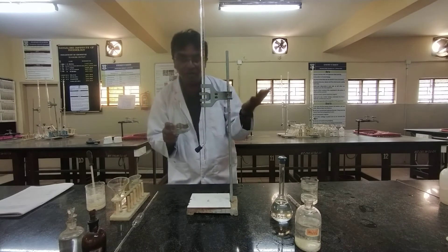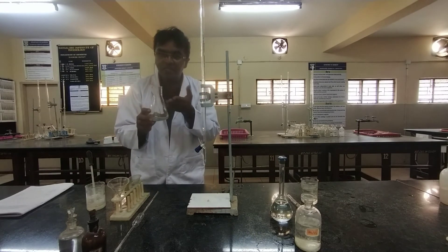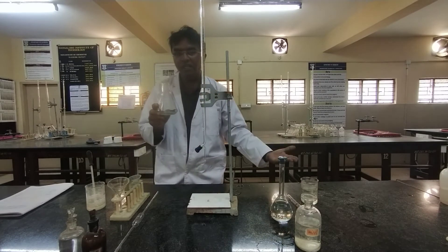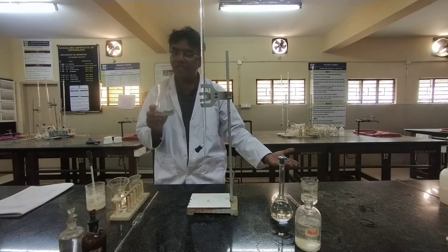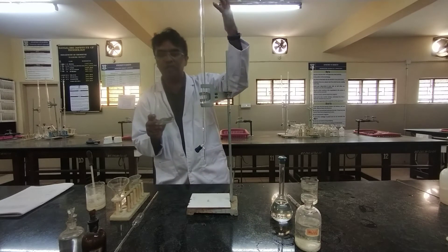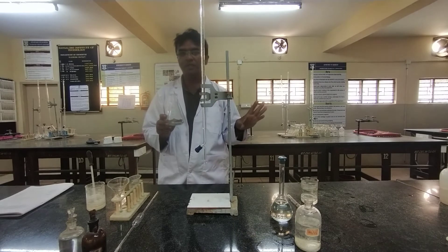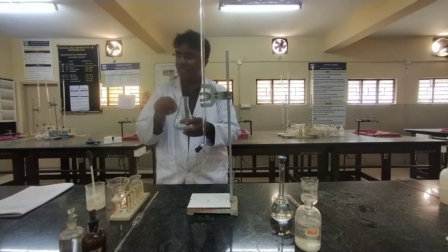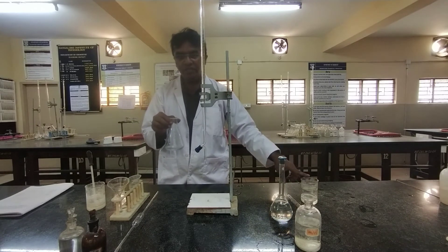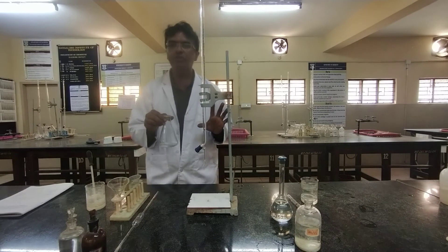Conversely, less is the percentage of copper, less will be the number of copper ions; less will be the liberation of iodine upon the addition of KI; and less amount of sodium thiosulphate is consumed. This is the concept. After pipetting out 25 ml of the brass solution, we need to add potassium iodide — but there is a small thing you have to observe first.